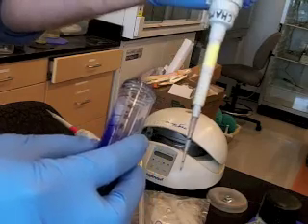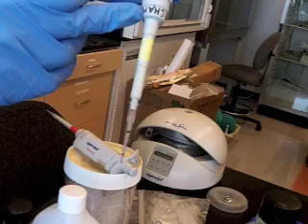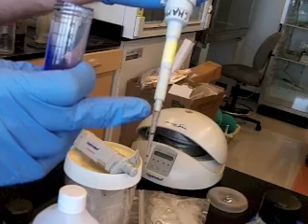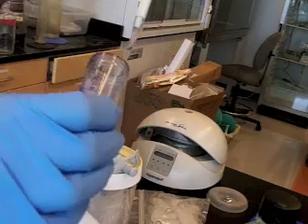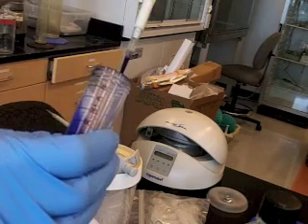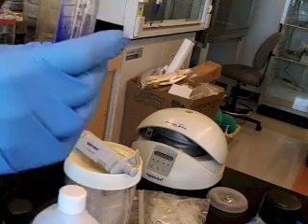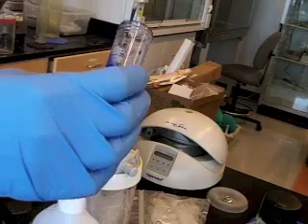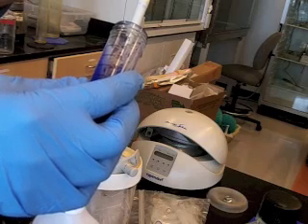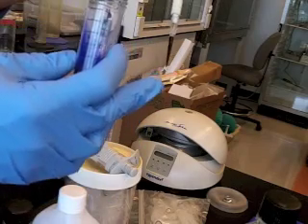You don't want to plunge the pipette deep into the liquid, because the pipette has some gaskets that can wear, and the pressure, kind of the pressure of the liquid, could cause the tip to fill. I don't know. Let's see if I can do a little bit of that right now. So if I push the pipette in far, if it's an older pipetter, some liquid would start to fill into the tube, and we don't let that happen. So it's appropriate to just put the tip in and then withdraw liquid, lifting up slowly until your hand is at rest. You don't want splashes to happen like that.